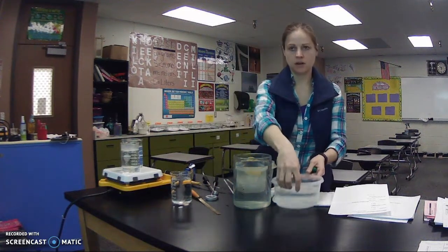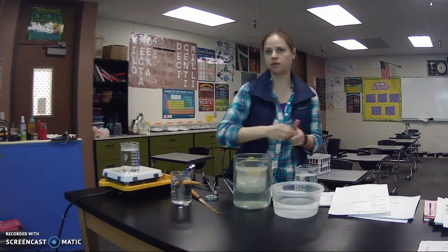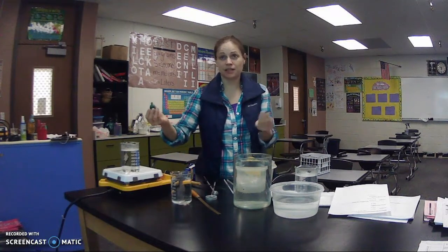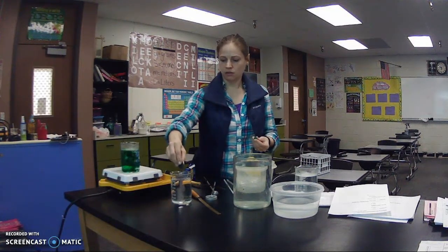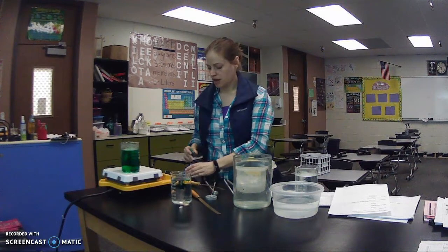Okay. Get this out of the way so that it doesn't distract you. Beaker A, beaker B. Watch what happens. This is where you need to observe. 1, 2, 3. 1, 2, 3. Okay, I'm not going to stir them.